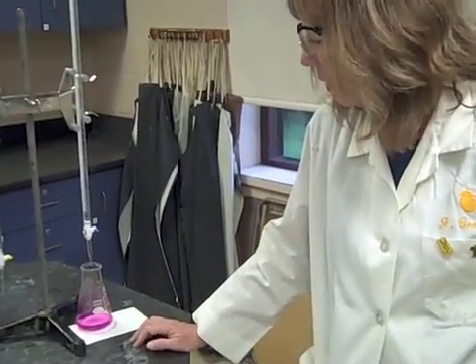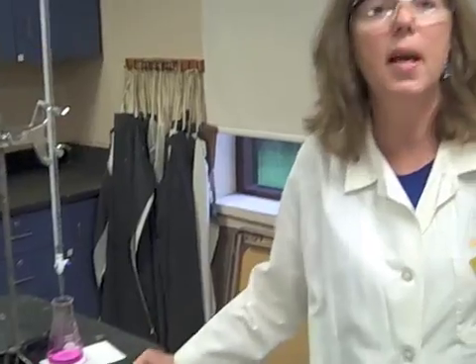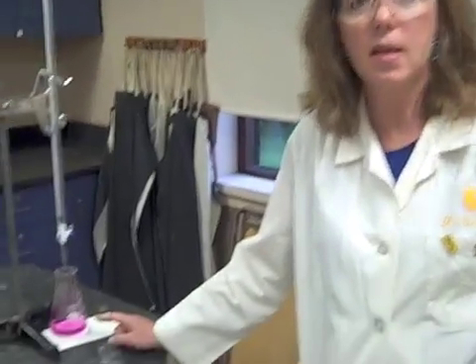So, what we're going to have to do, I will use another burette to finish this off in a moment. But I just wanted you to see this.